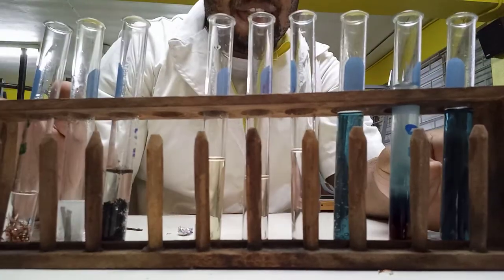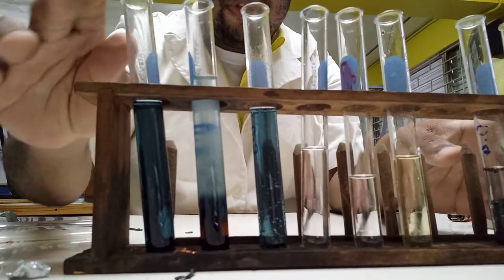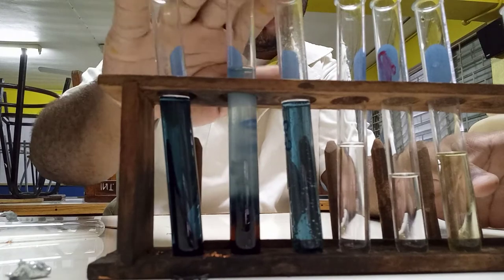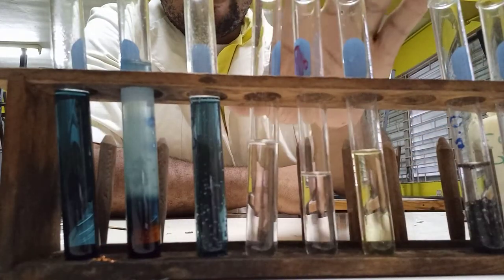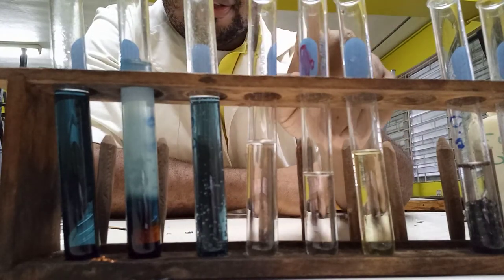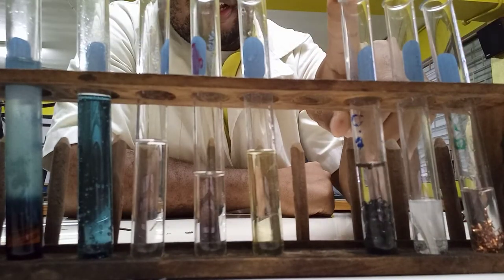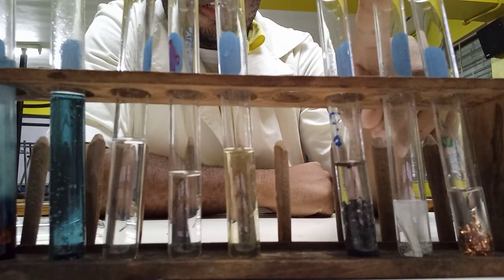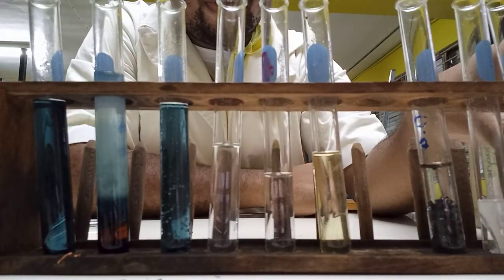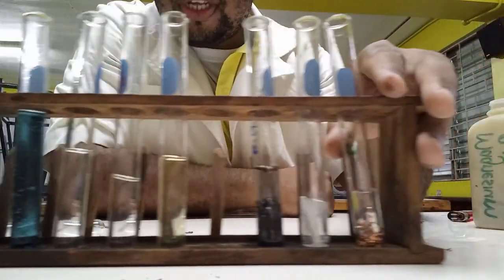That's it for this video on redox reactions. Before I close, here is the final look at all the reactions: these three test tubes were the potassium dichromate reactions, these three are potassium permanganate — hydrogen peroxide, alcohol, and iron sulfate. This is zinc in copper sulfate, this was magnesium with hydrochloric acid, and this is copper in zinc sulfate. These were all the redox reactions we looked at.